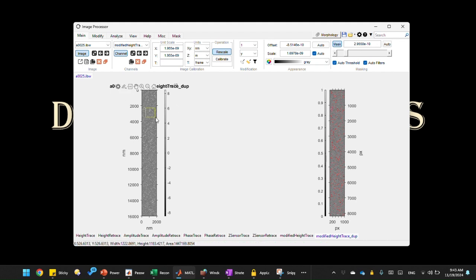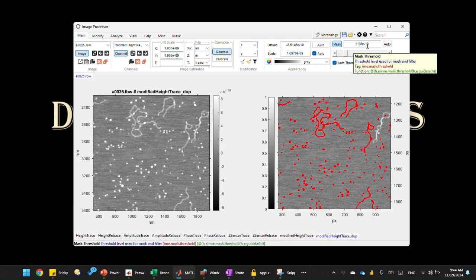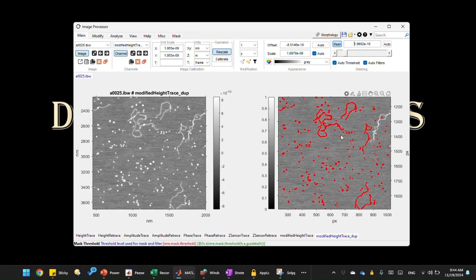Let's see if the mask looks good or not. Let's zoom in on this image. I can use the automatic one. And we need to mask the DNA, so we need to use the data above the surface background. So let's just reduce this mask a little bit. It seems okay, a good value. We can probably reduce a little bit more. We can reduce a lot more. Yeah, I think we're good.